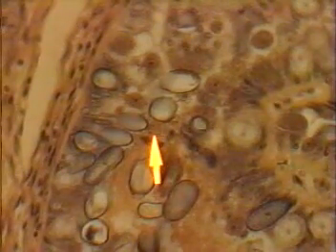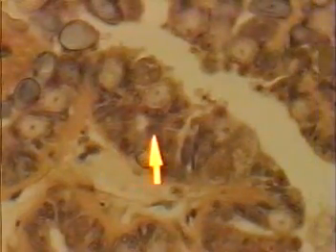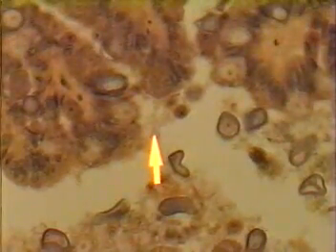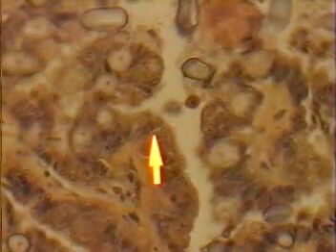Because this is a fairly old infection, most of the infected cells are containing just the micro and macrogametocytes, and it is extremely difficult to find schizonts containing the merozoites. At one point early in the infection, most of what you would have seen were the schizont stages, and so I'm not going to ask that you find any of those.